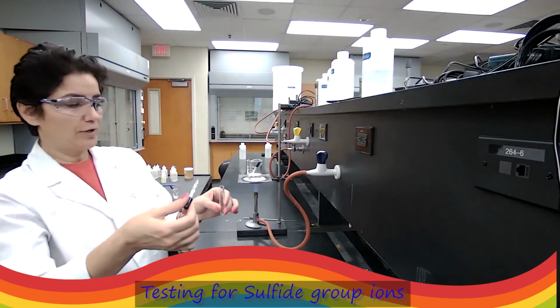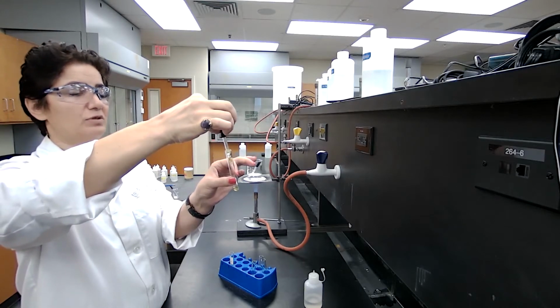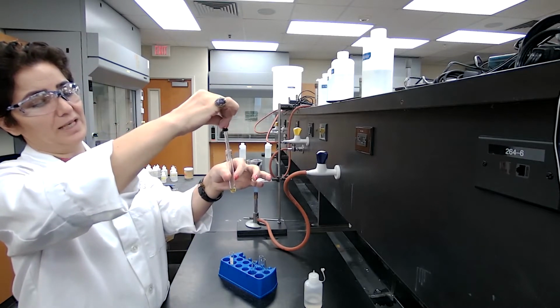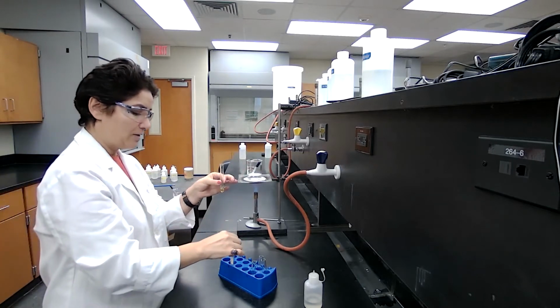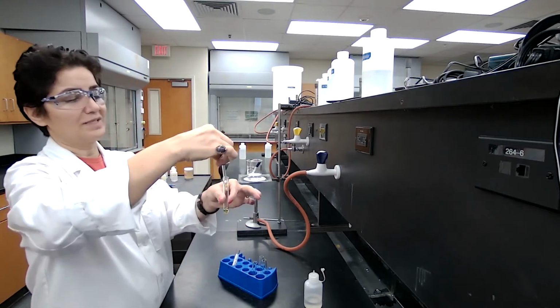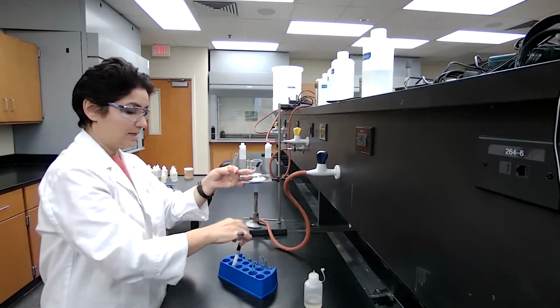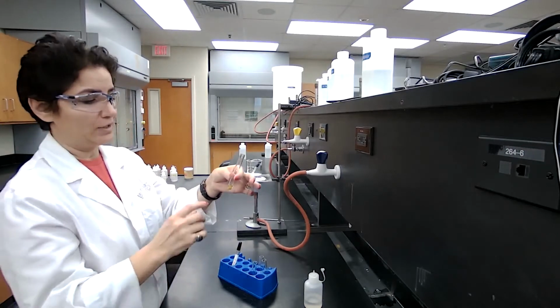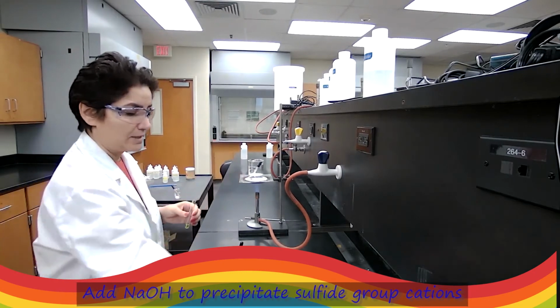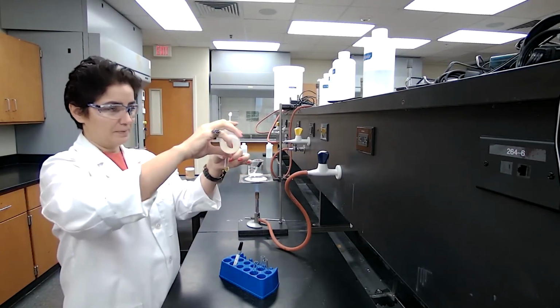Okay. For the sulfide group, I'm going to start with 20 drops of the unknown that is given to me. The letter for the unknown is unknown F, and I label this test tube A, so I can keep track of the steps and which solution I'm working with. I add the 20 drops of the sample. I use the marker for labeling because I need to use the centrifuge often, and I do not want the marker or the tape to fall into the centrifuge. Then I'm adding 10 drops of sodium hydroxide to precipitate.